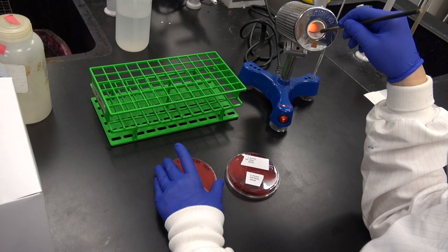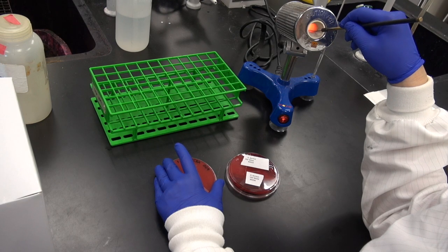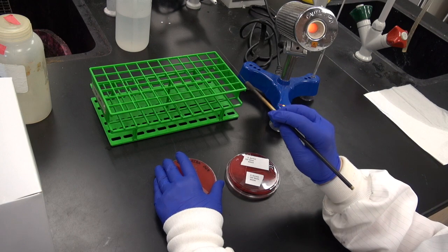Re-sterilize the loop as before, allowing it to cool for a few seconds before moving on to the next step.